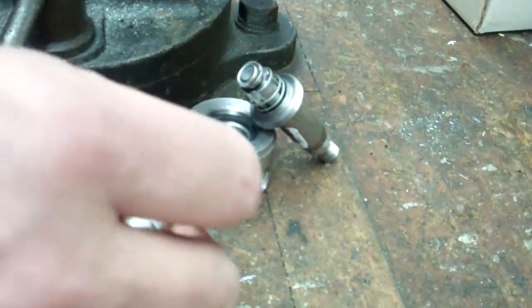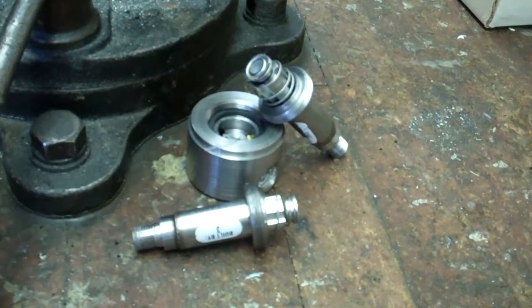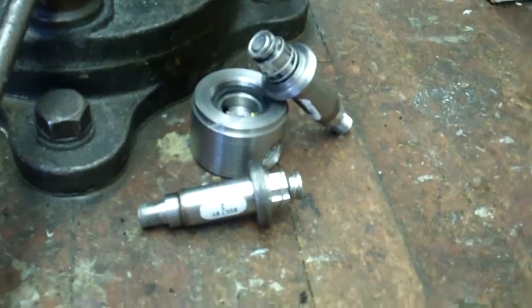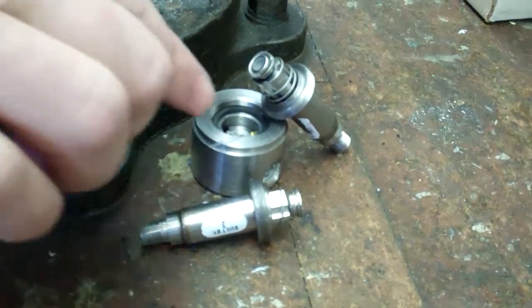I think something happened to this valve, which means it would not be a warranty replacement. We can sell them a new valve. That's the end of this discussion on the two-way solvent valve and a return and some odd stuff inside.